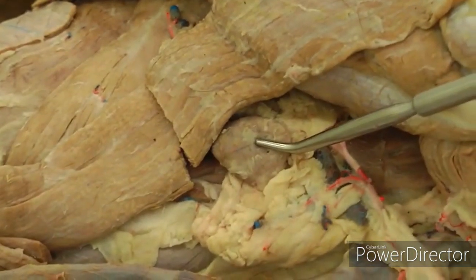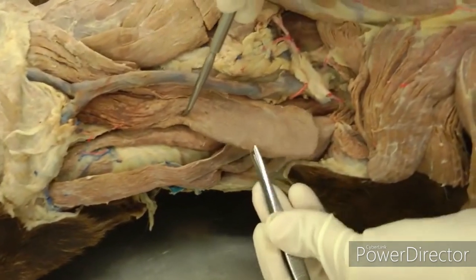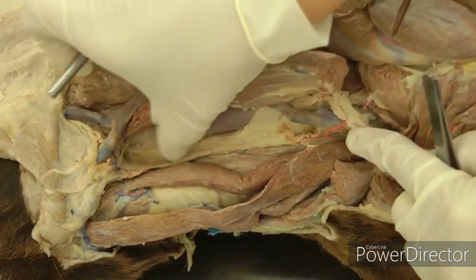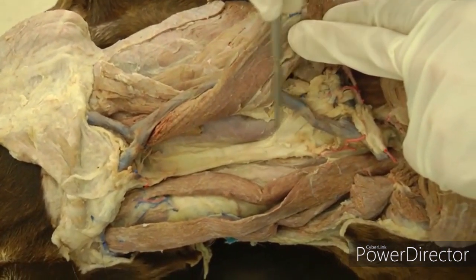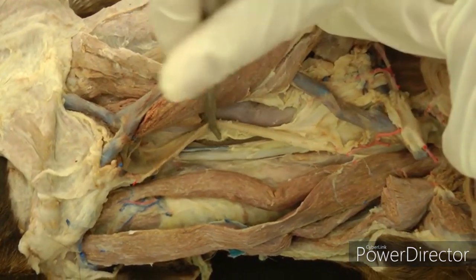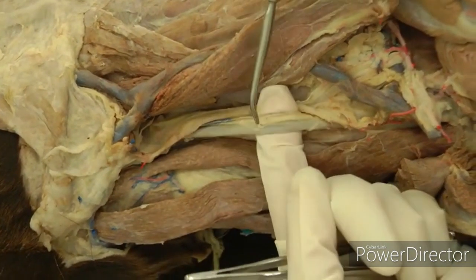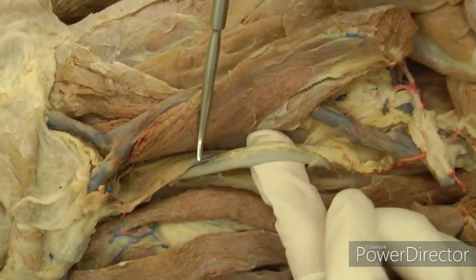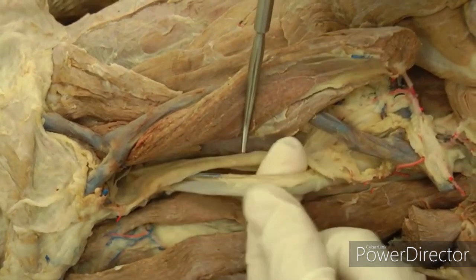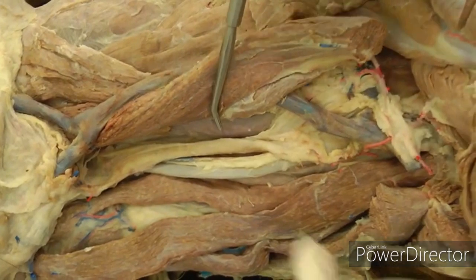The superficial cervical lymph node should be right there. Then if you move back down towards your stern muscles that you just did, you're going to look here in the neck and find the deep fascia of the neck, and in that white fascial area you're going to find the carotid sheath. You're going to pull that out of there — it will have your carotid artery and your vagosympathetic nerve trunk in there.